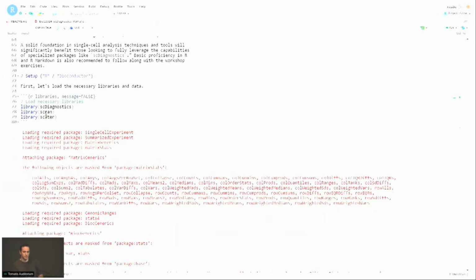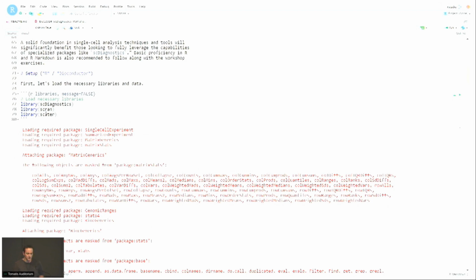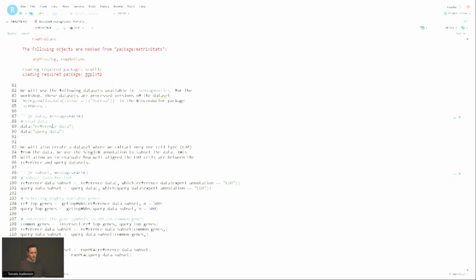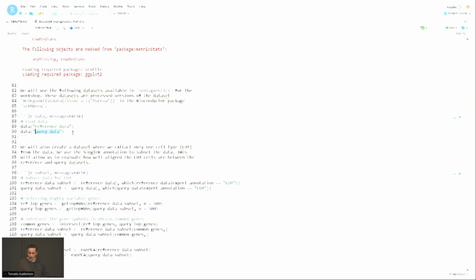So I'm loading the scDiagnostics package, and then we'll add some PCA reduced dimensions to some single cell experiment objects, so we'll need to load scran and scater as well. Okay, and as part of the package, there are 2 data sets available. In fact, there are 3, but I'll only use 2 of them today. There's the reference data, which is the data that was used in the slides, the 70% curated reference data set. The reference data set only contains the expert annotation. And then we have a query data set, which contains the expert annotation and the SingleR annotation as well. So we're going to load these 2 data sets.